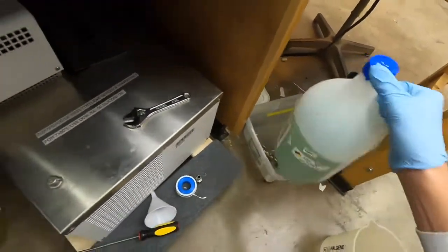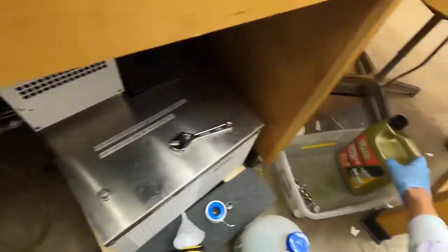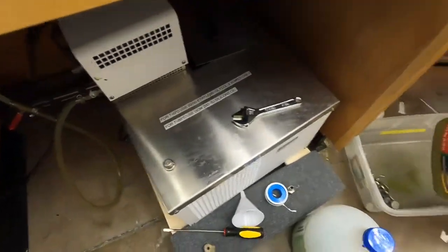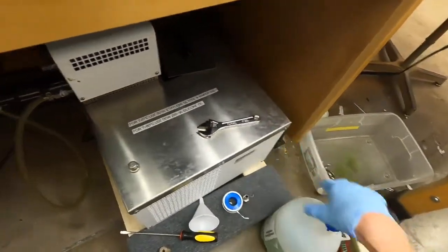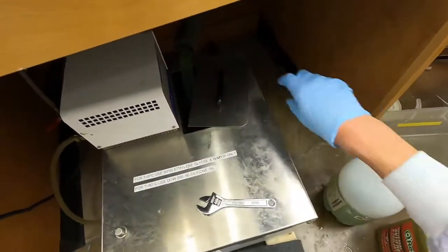But before we turn that on, we'll get our antifreeze ready. We're going to use antifreeze because we're going down to negative two degrees Celsius, so you can't use water because it'll freeze up. To start, we'll pull this out.